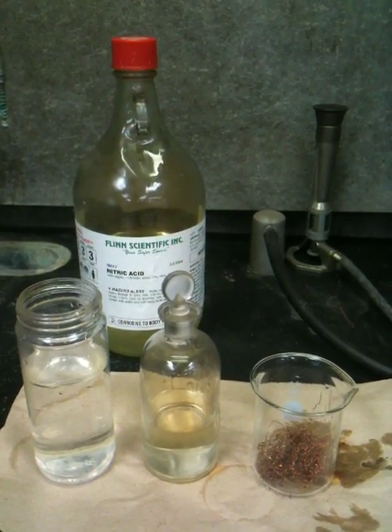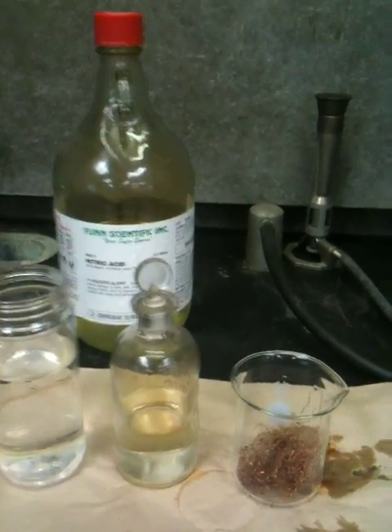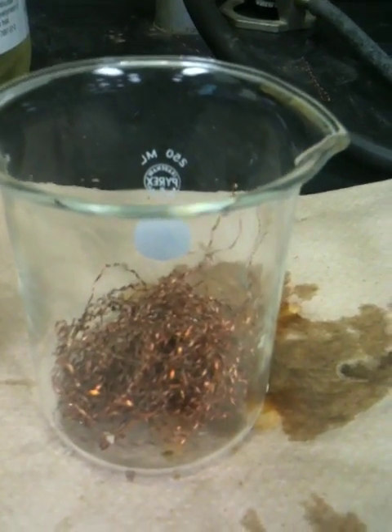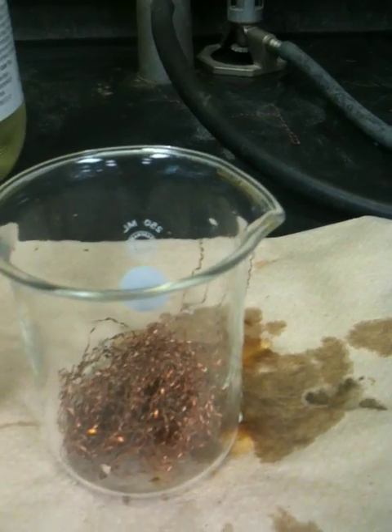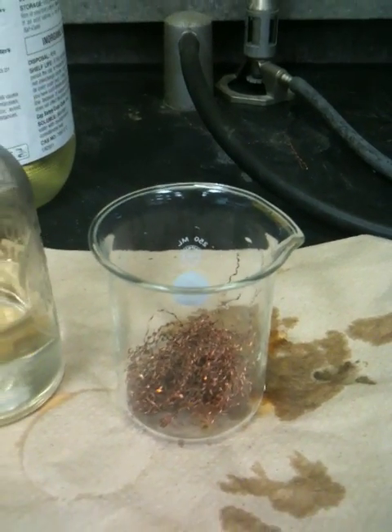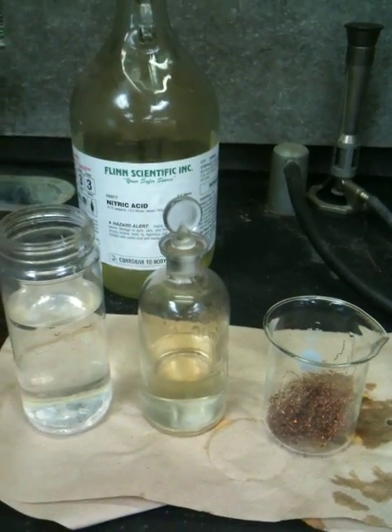I'm going to be demonstrating the effect of nitric acid on copper. I have copper in this beaker here — it's like metal turnings from a lathe or a drill, which makes lots of surface area so this reaction can go a little faster than it might otherwise.